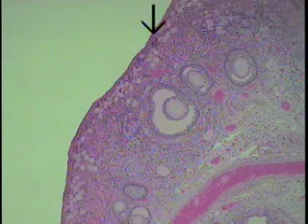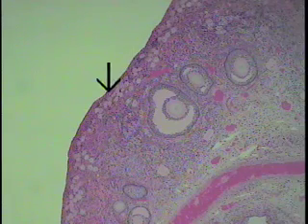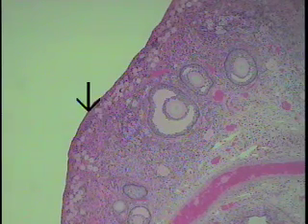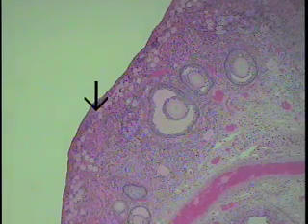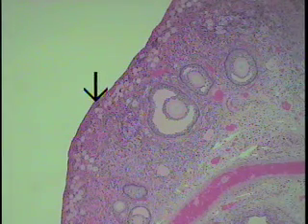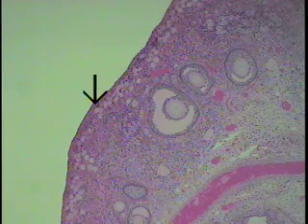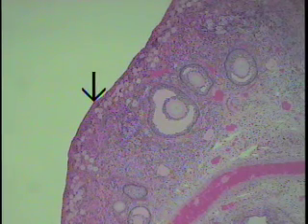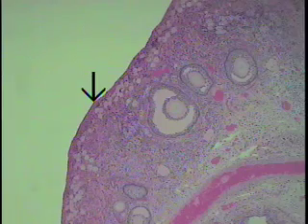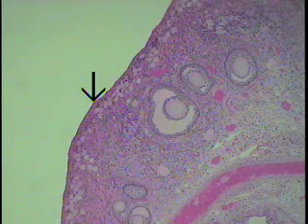The tunica albuginea also surrounds the ovaries, as it did the testis — it's this dense connective tissue band right here — and we'll see that it's going to be surfaced by a peritoneal covering of mesothelium, known as the germinal epithelium of the ovary. Let's go down and look at these now at increased magnification.